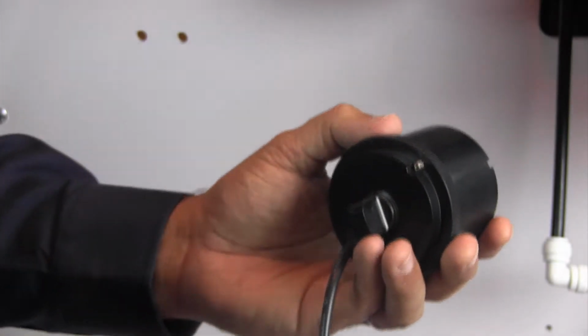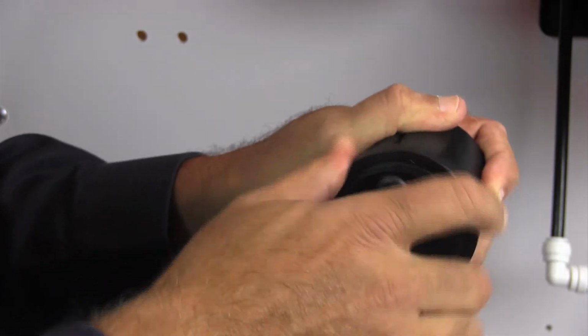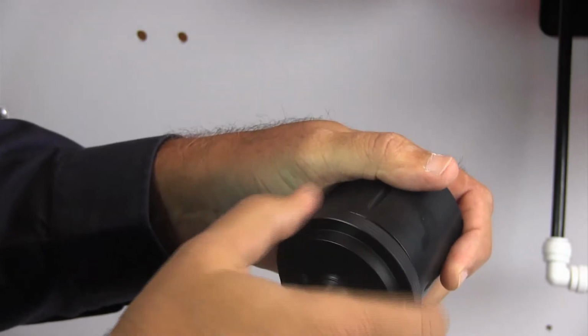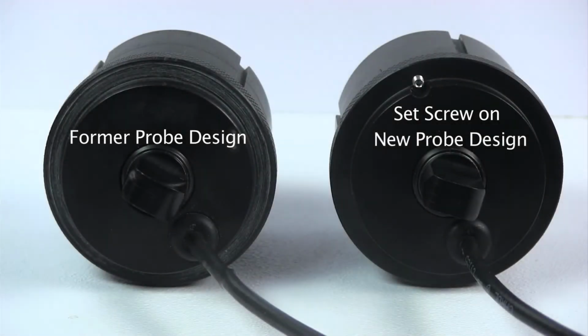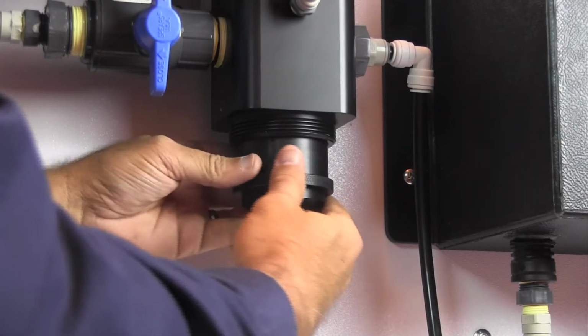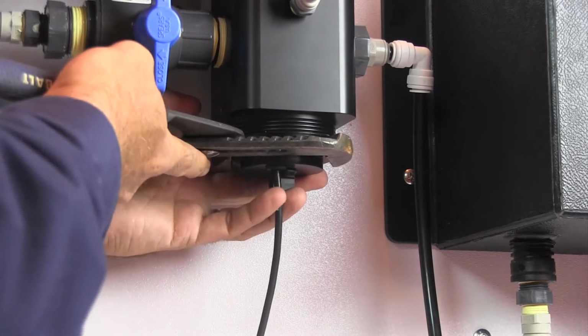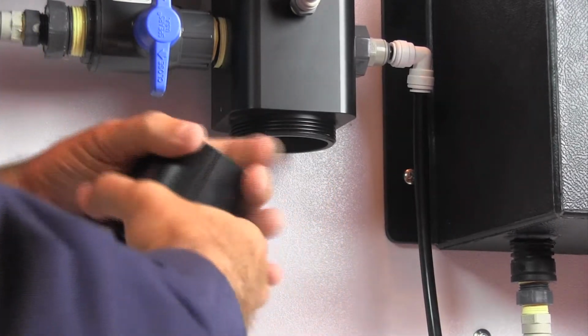Loosen the set screw and remove the probe housing. This will reveal the probe sleeve and electrodes. It should be noted that on some earlier models there was not a set screw. If unable to unscrew the housing by hand, insert it back into the DT4 block and use channel locks to grip the knurled ring and loosen the housing.